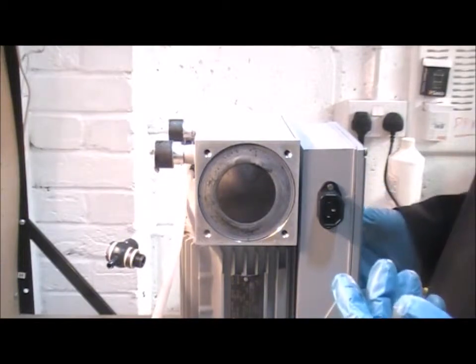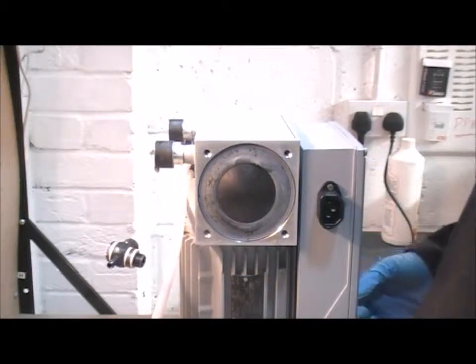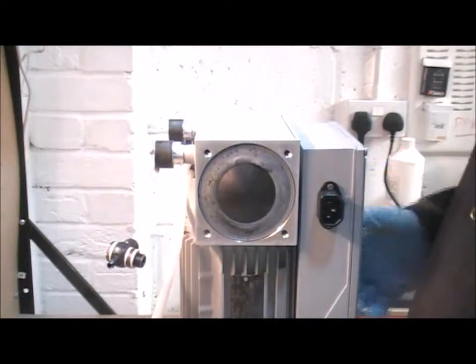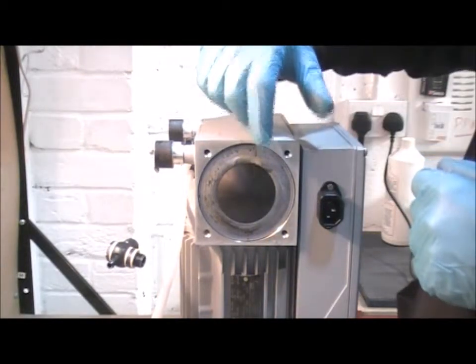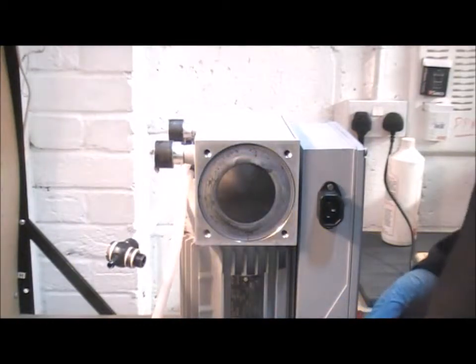On this pump, I've mounted it so that the shaft is vertical. On this particular type of pump, it's a little bit easier to do if you get them that way round. You can see I've undone the four bolts, removed the head, and here's the damaged diaphragm. It's split right here. So this has got to come out. I've got a replacement that I'm going to put in a moment.